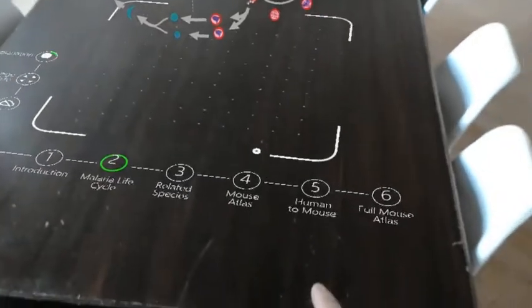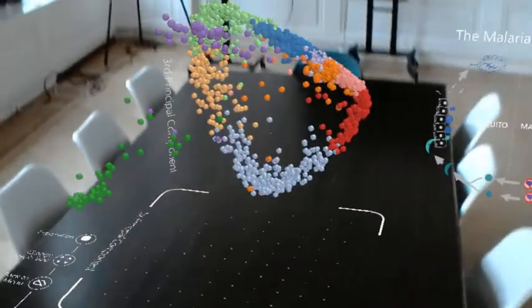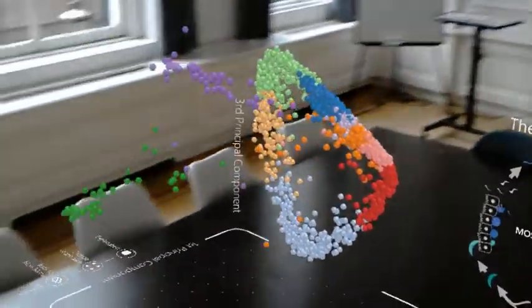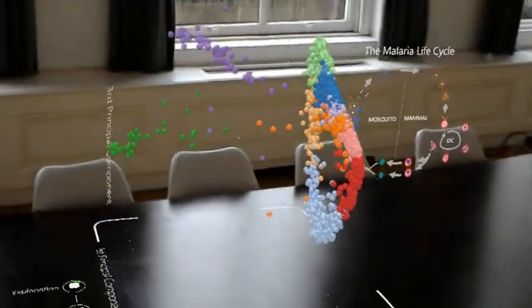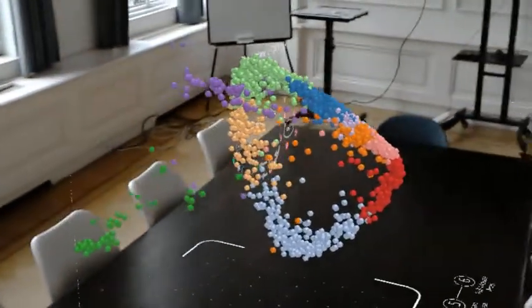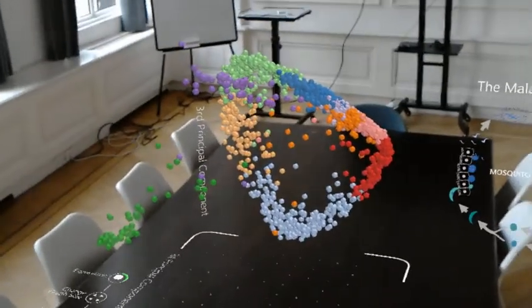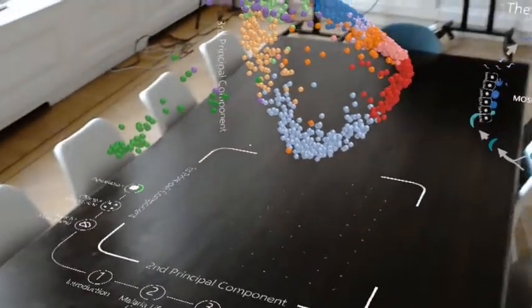And this research is very data heavy, so if you move on to step 4, which is one of the data sets that's been used in this research, you can actually see a 3-dimensional representation. And it's quite important to see this 3-dimensional representation because it is about the structure of these green and purple data points that come out of this circle.